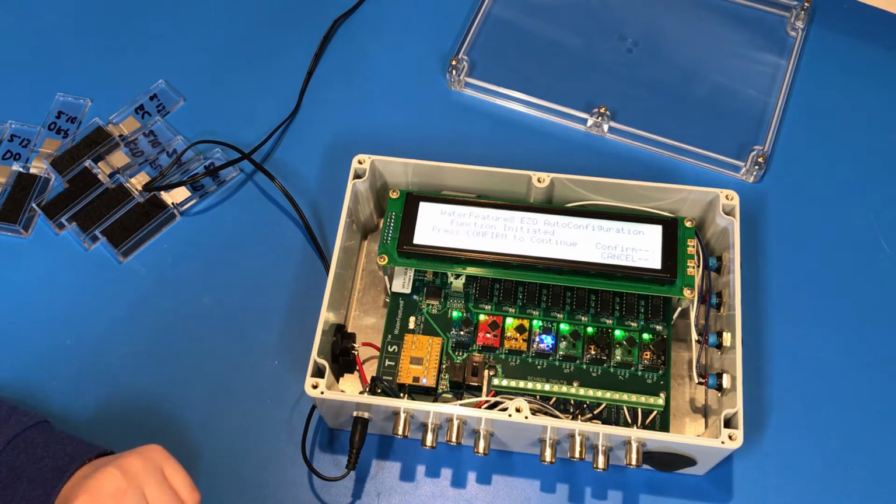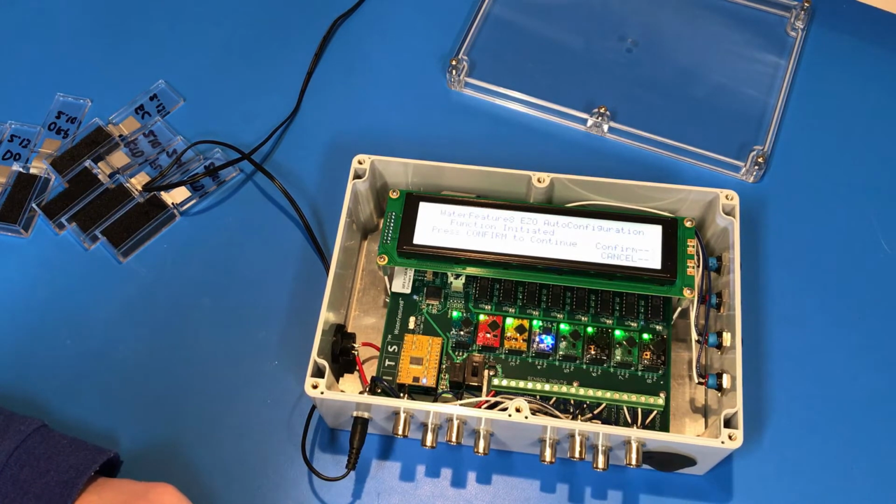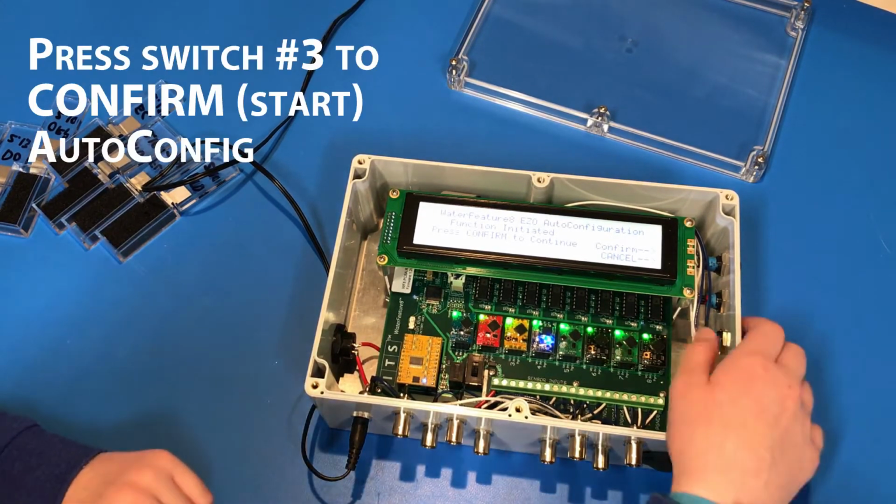What it will not do is overwrite any calibration settings on your EZO circuits. So if you've, say, got a DO and you've already calibrated it to your sensor, you will not lose any of those settings. It's only the communication protocols that are needed to make the Water Feature 8 function. So go ahead and press confirm.